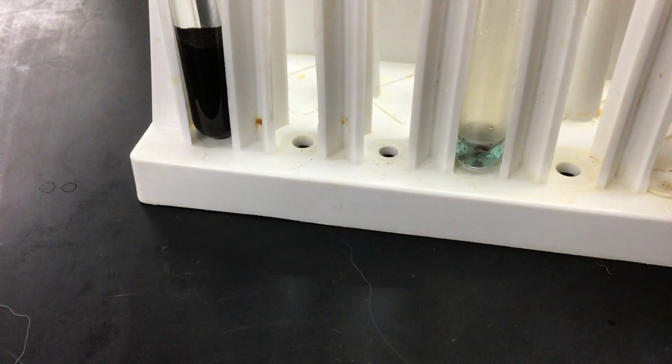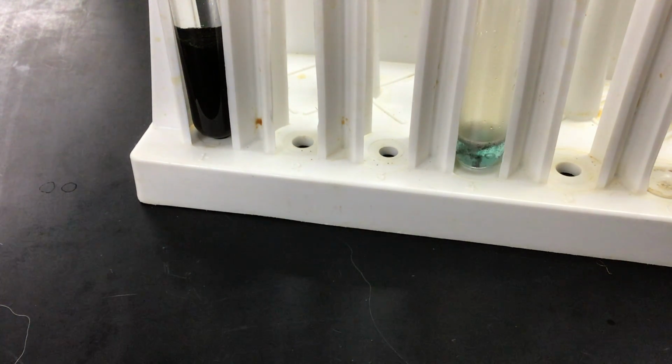You're starting to see the presence of the blue solution, which now does indeed confirm the presence of copper. And the gas that's forming off of it is, again, nitrogen dioxide, which is not good to breathe in. So I'm going to stop this video very quickly. But you can see that indeed it has dissolved and formed a nice blue solution, and the presence of copper is confirmed.